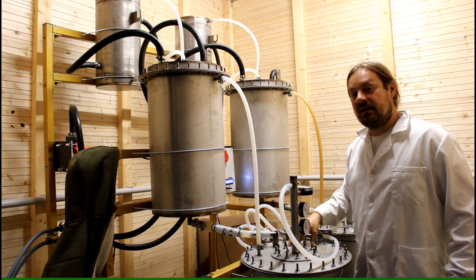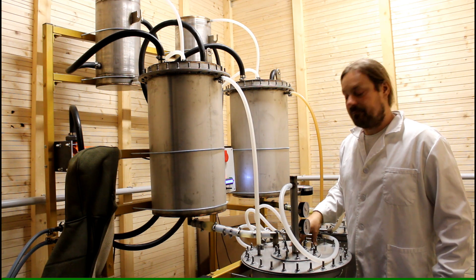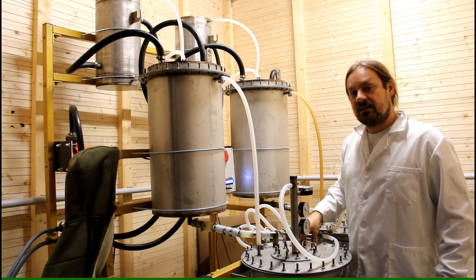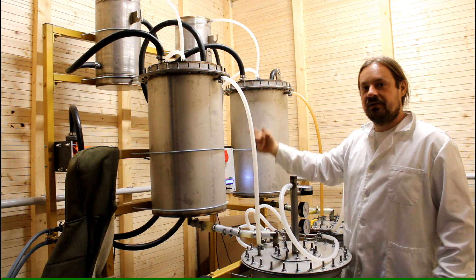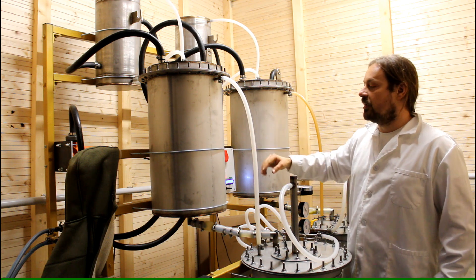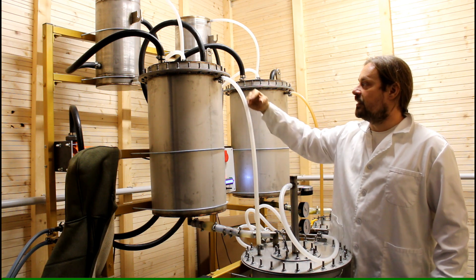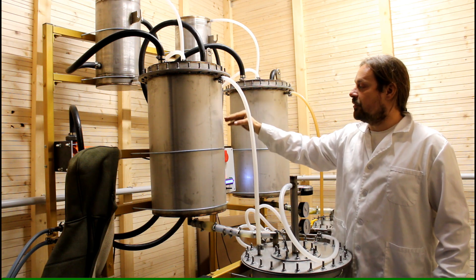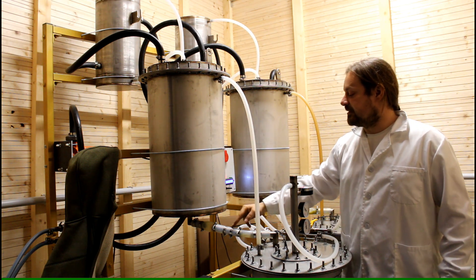And this is a continuous extraction. That means it's running all the time. There is a circle. Fresh solvent comes up here, runs through the herb and the extract comes down here.